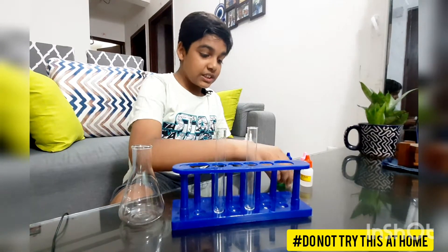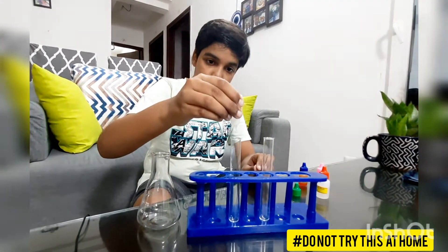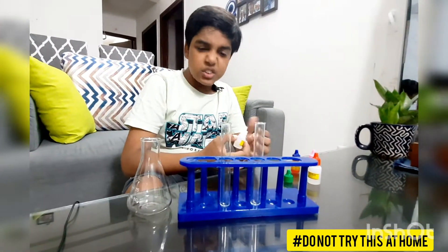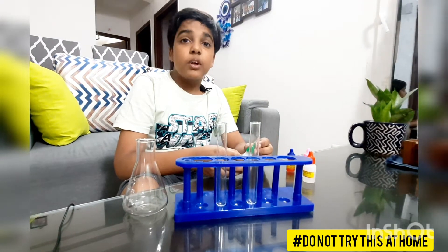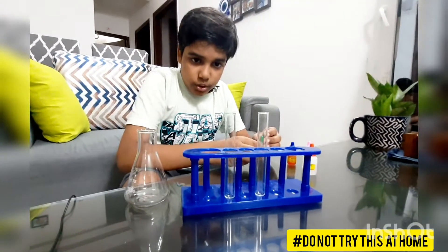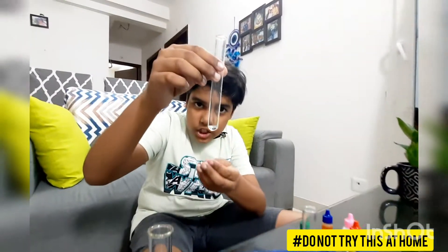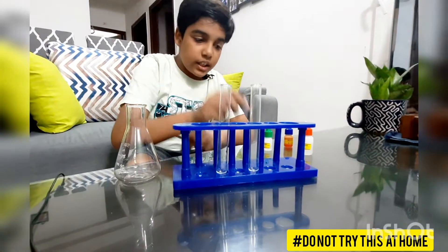In the first test tube with phenolphthalein indicator — I pour this in — but there is no color change. Why? Because it has acidic properties. There is no color change here. As you can see, no color change, which means it is acidic in nature. Now let's try the other solution.